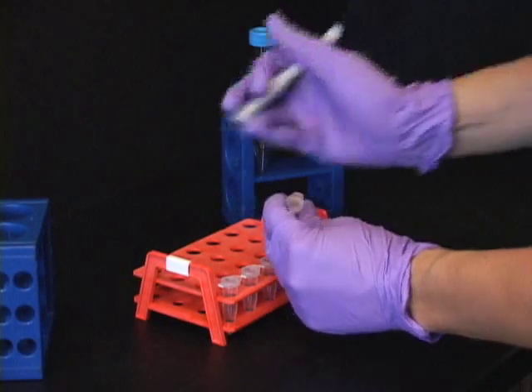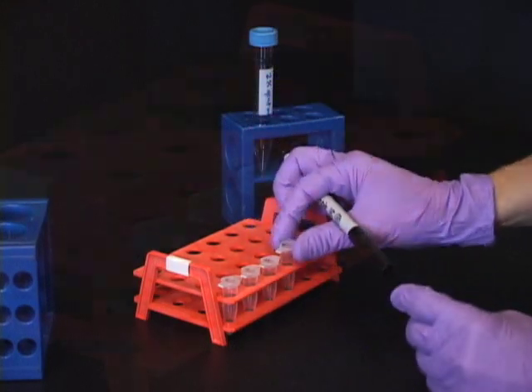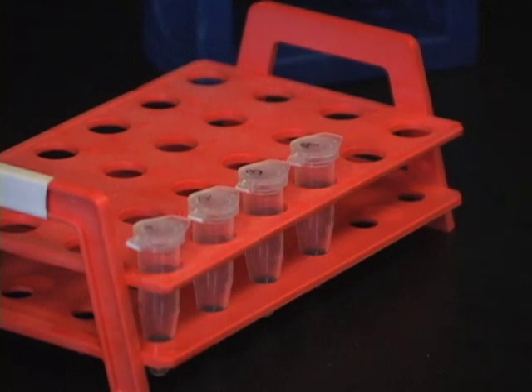Label 1.7 mL low retention microtubes in multiples of 4. We use tubes from Genesee Scientific.